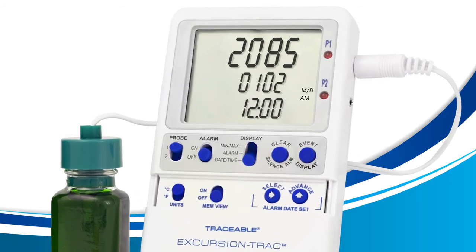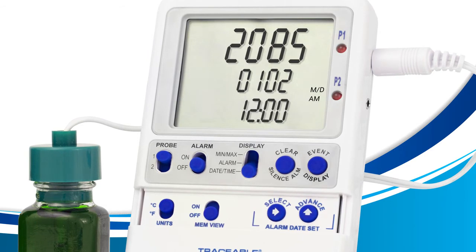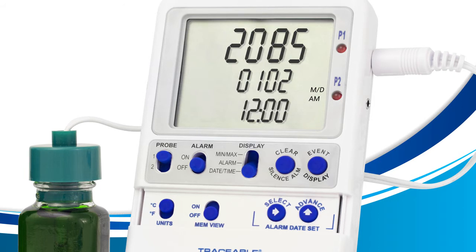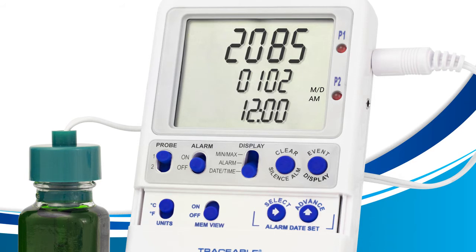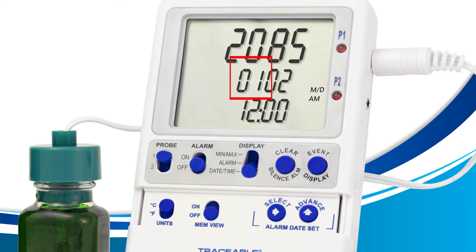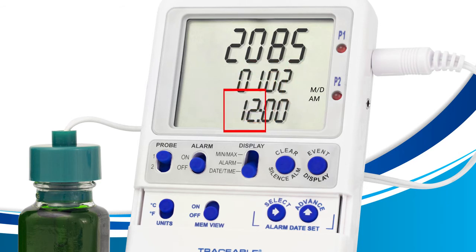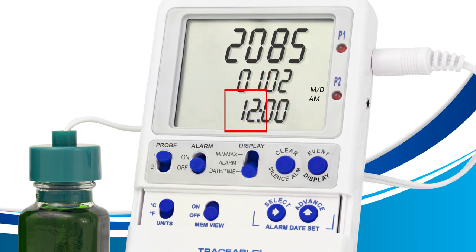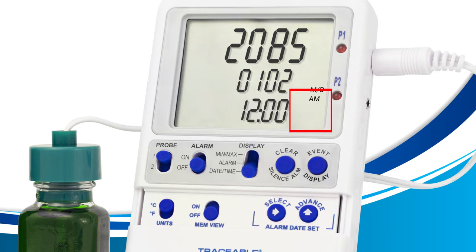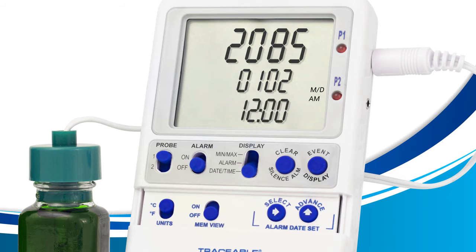Let's learn about each button individually before we use them together. First, the select button: pressing the select button allows you to select the fields you'd like to edit the values of on your screen. Each press of the select button chooses a different field, starting from the top and working its way down from left to right, just as if you were reading a book. Grab your device and let's practice using the select button together.